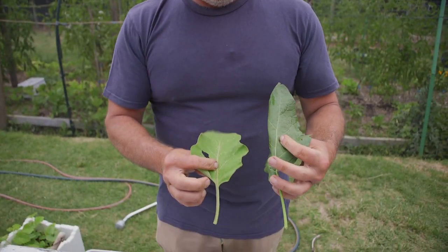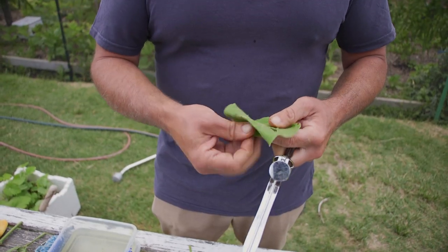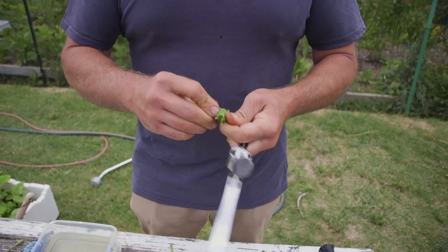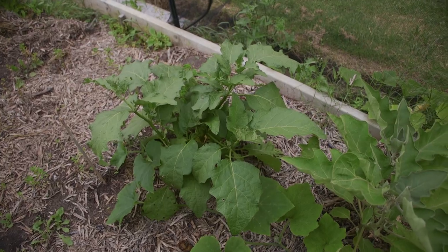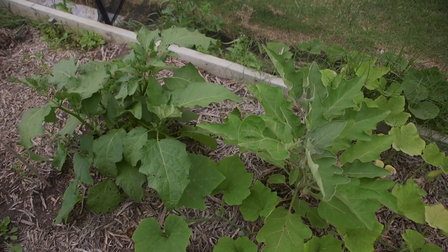The last test before we go - these two. We're going to start off with the lighter colour eggplant. Both these have had no extra treatment. They've both had the same soil preparation prior to being planted and they're right beside each other, about half a metre apart. So this is the lighter one, let's give this a go.